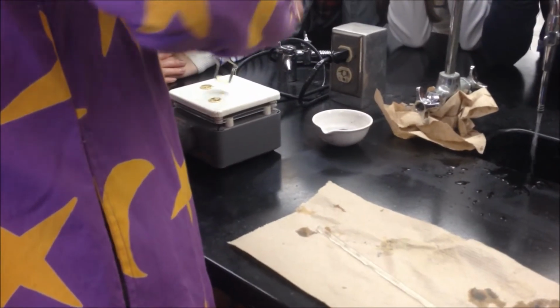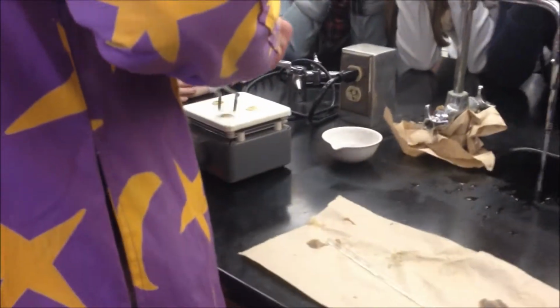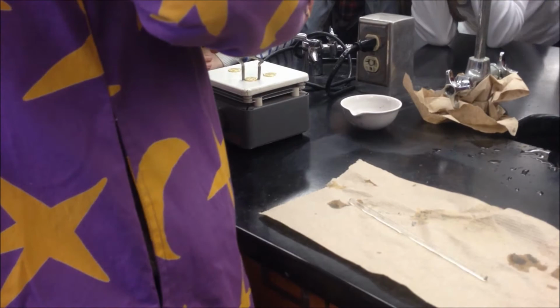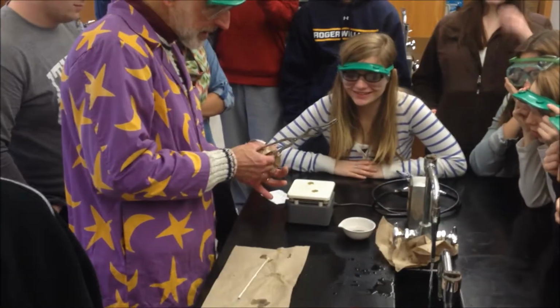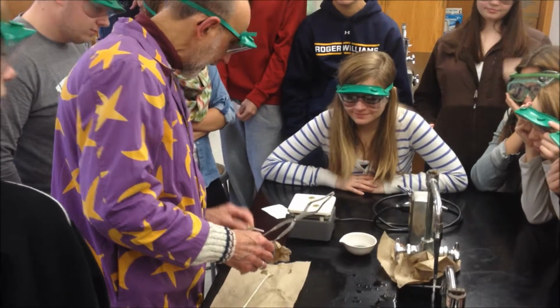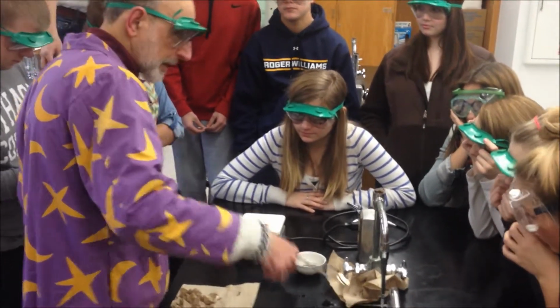Guess. Okay, now think of what I did. The pennies were copper. I coated them with zinc. Now I didn't melt the metals, but the heat is enough to soften the metals so that they mix. They look like Chuck E. Cheese tokens. So you could make your own. The heat softens the metal enough that the copper and zinc combine to make brass.